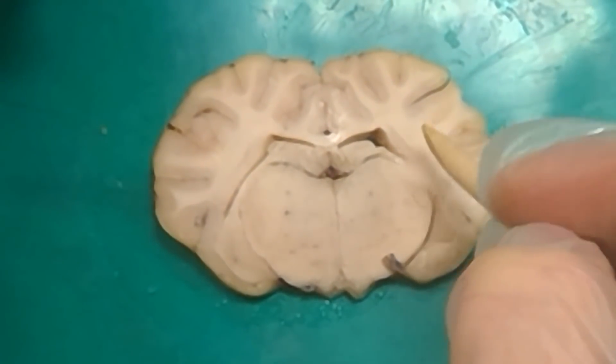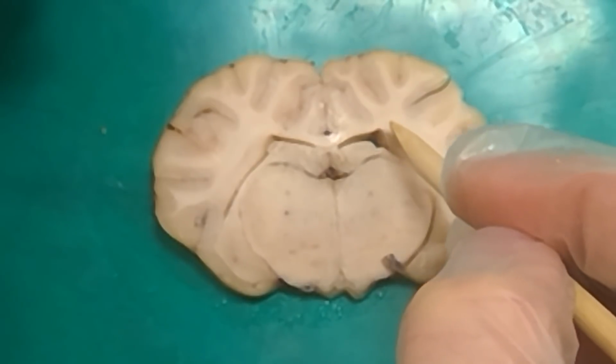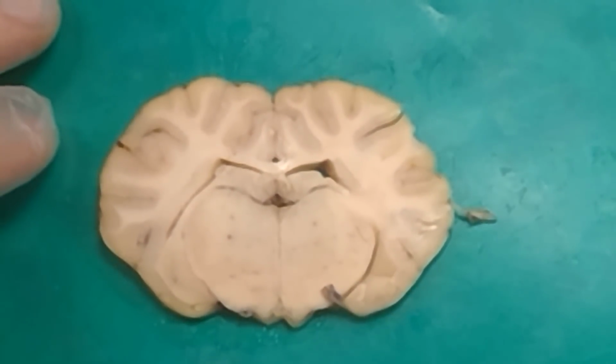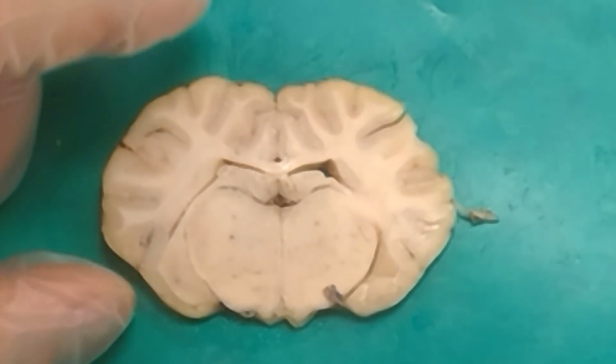Yes, right below the lateral ventricle. This nucleus up here, does anyone know what this is? Caudate. That's still the caudate. It just keeps moving up and pretty much stays. So if you see a pin on the lateral side of the lateral ventricle and it's gray matter, that'll be caudate. It has this long tail. It just keeps going back for days.